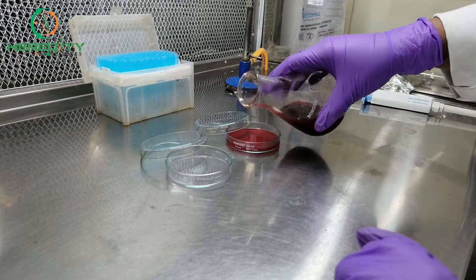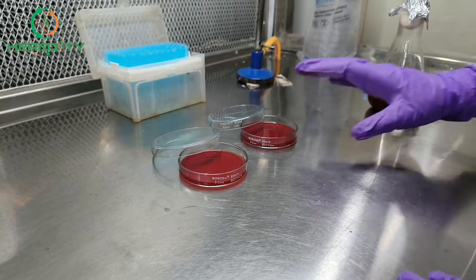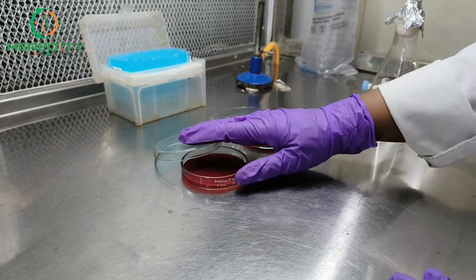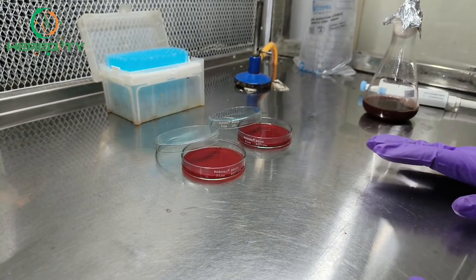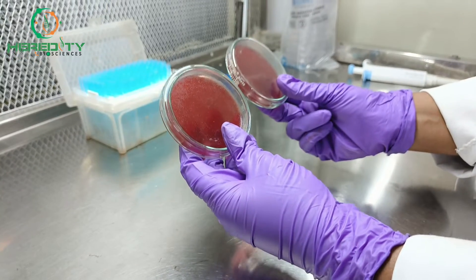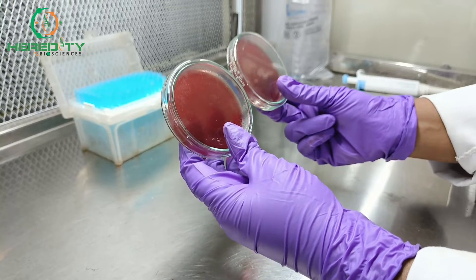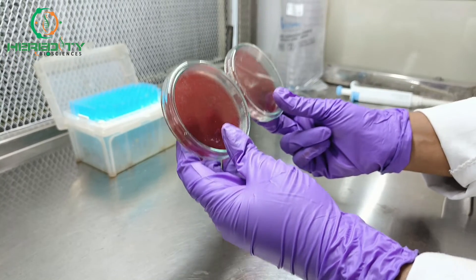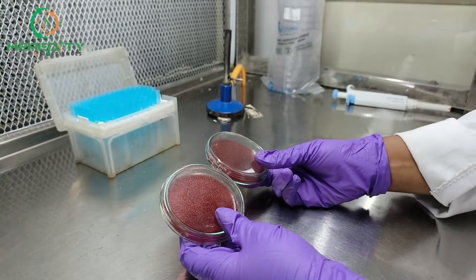Now we will pour our blood agar into these sterile petri plates. Make it bubble free. Now we will wait till it is solidified. Our blood agar plates are completely solidified and ready for the growth of microorganisms.